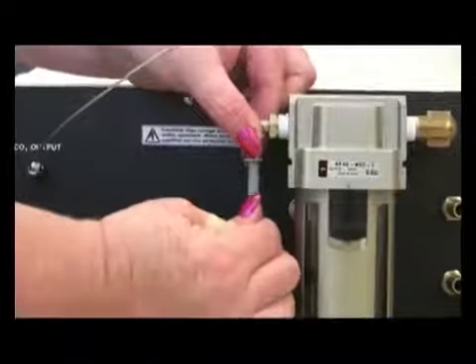The air hose coming from your compressor is connected to the air pump with a pressure fitting.